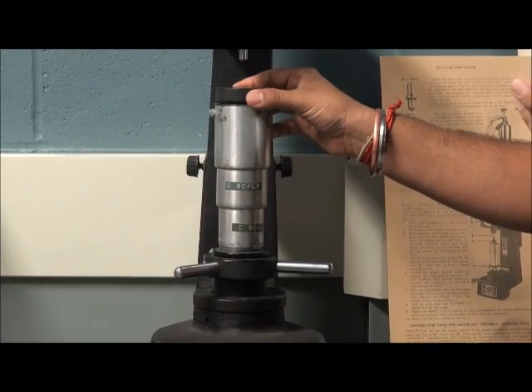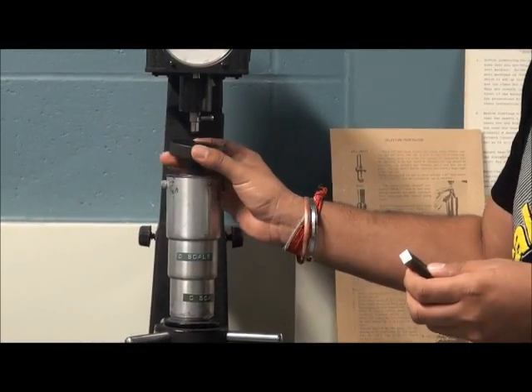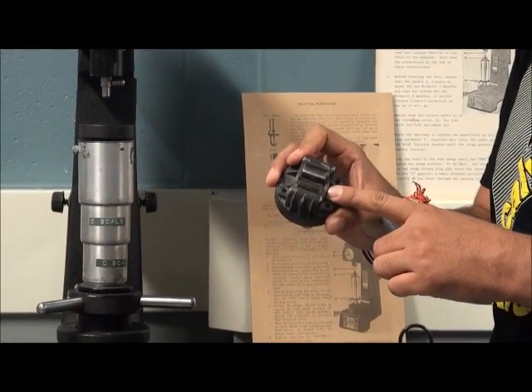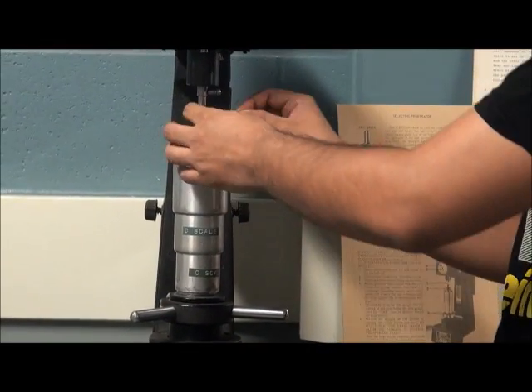For the flat objects, we are using the flat platform. And for the circular or curved objects, we are using this platform. Now we can place the sample over here.